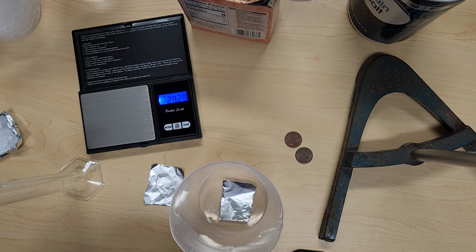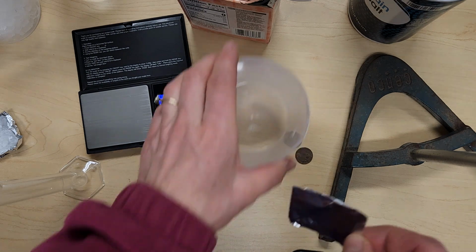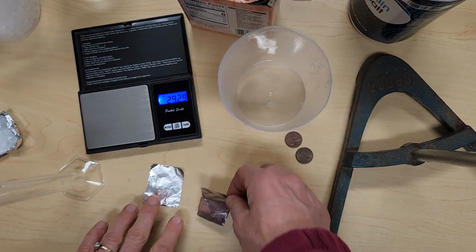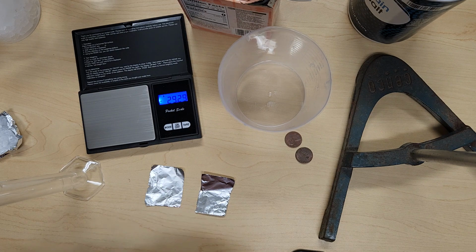Okay. Once the 10 to 15 minutes is over, remove that aluminum foil. Okay. Rinse it, dry it off, and we can compare it to that piece of aluminum foil that we did not do anything to see if any changes have occurred. Make sure you take a picture, record your observations, explain why you think either a physical or chemical change has happened. Okay.